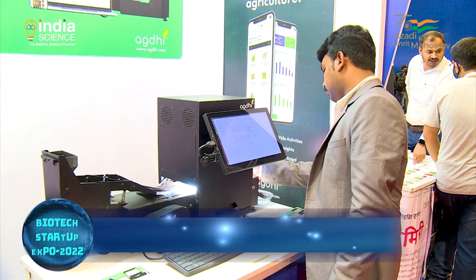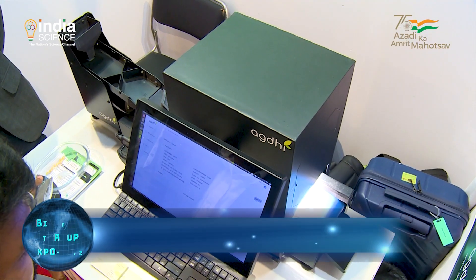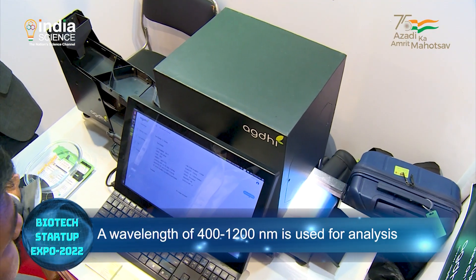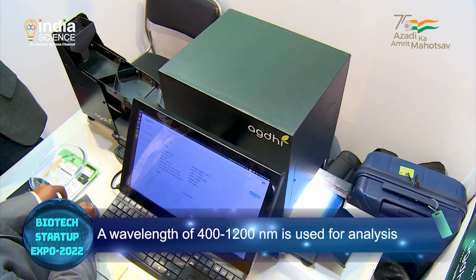With Seed Vision, we are able to analyze the genetical purity of the seed — whether it is a hybrid, or whether it is a male or female of the seed.